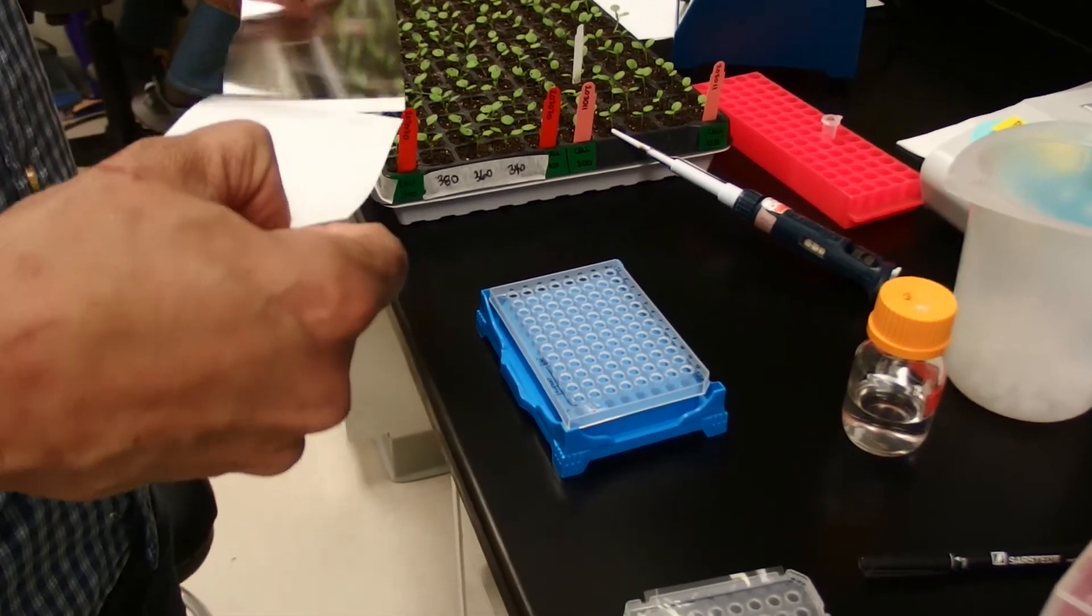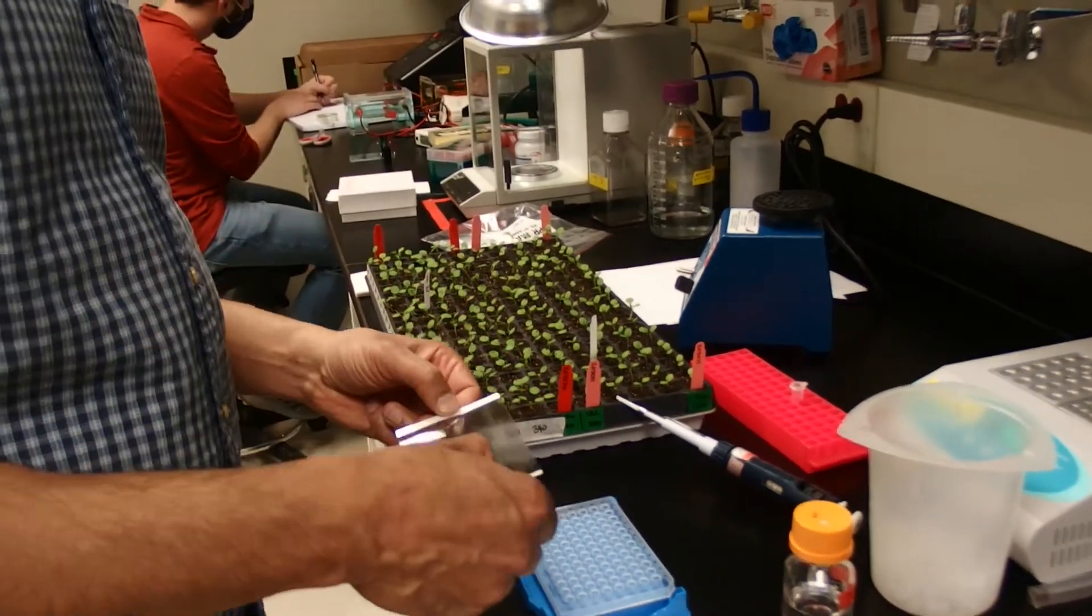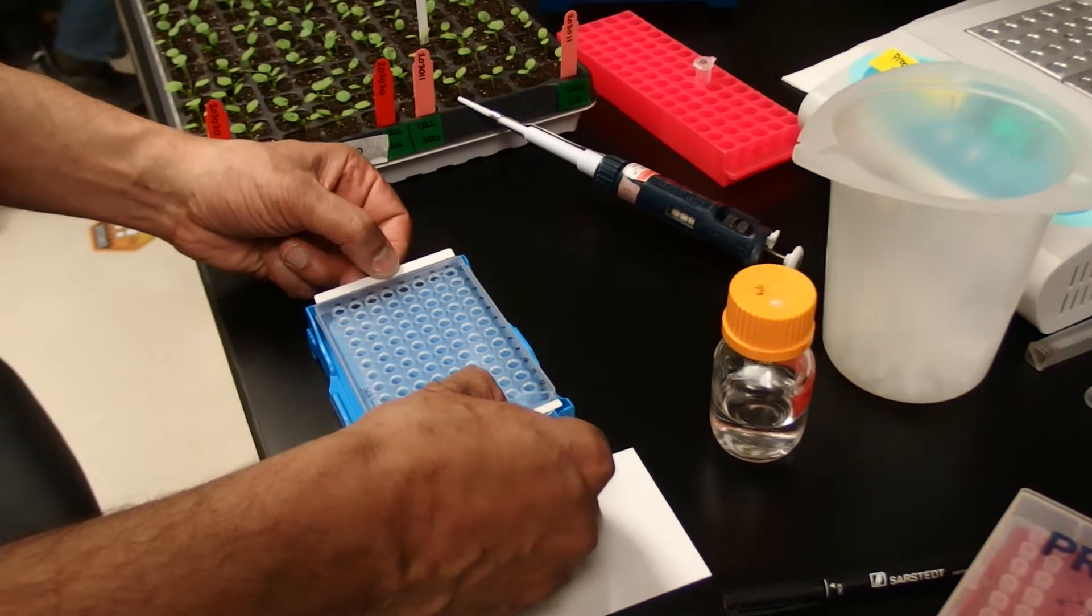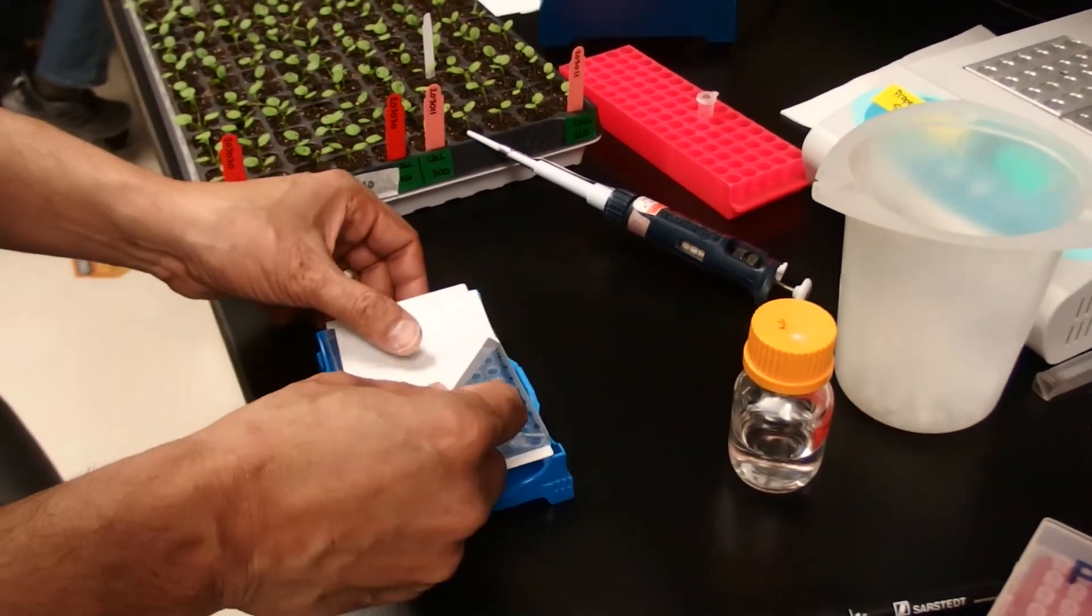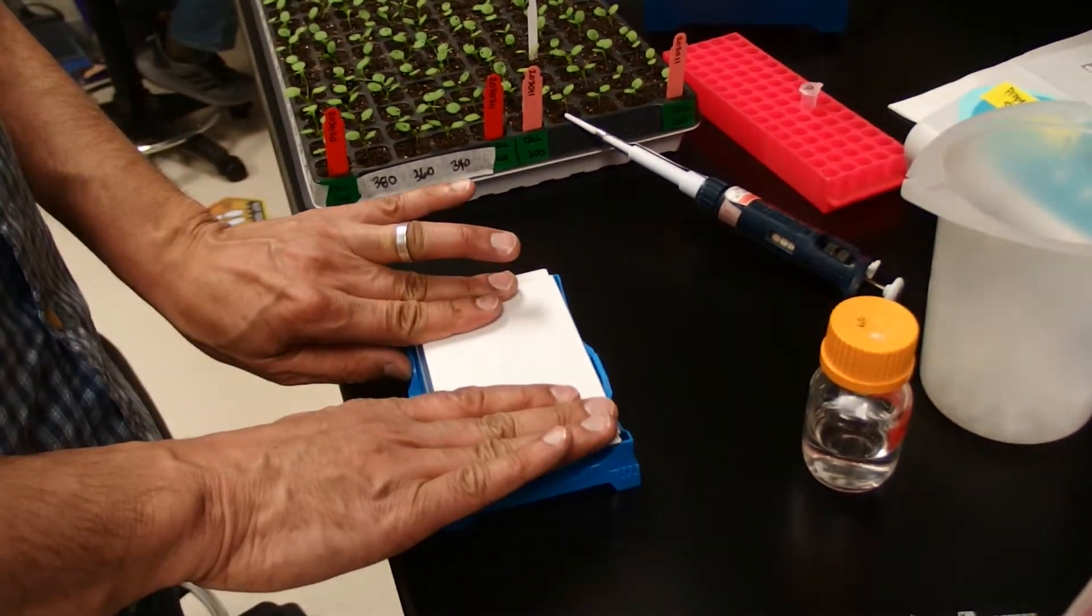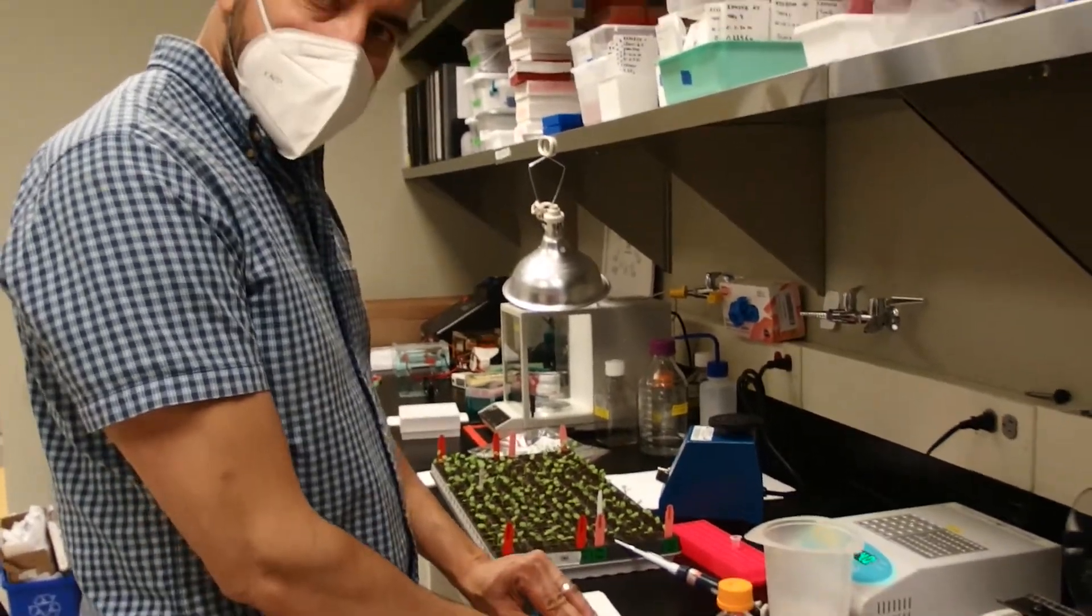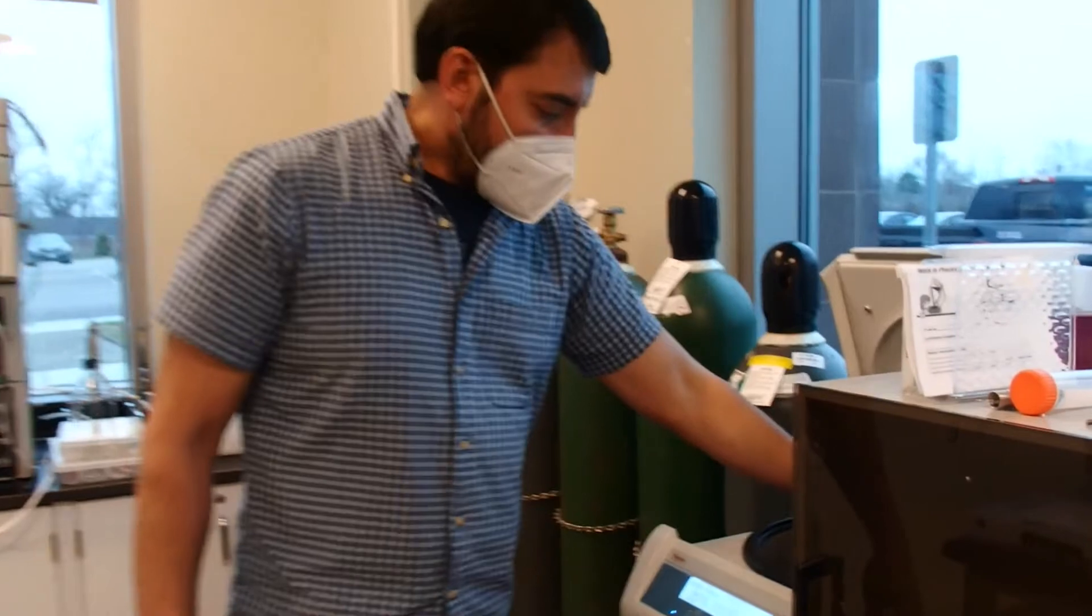Something tells me this film will actually probably work fine for the qPCR as well. We could try it one time, it's a lot cheaper. I'm going to seal this up and we're not going to throw this thing away until we make our final genotyping calls and we're happy with it. We'll spin down this plate and then we'll mix it and then we'll spin it down again.